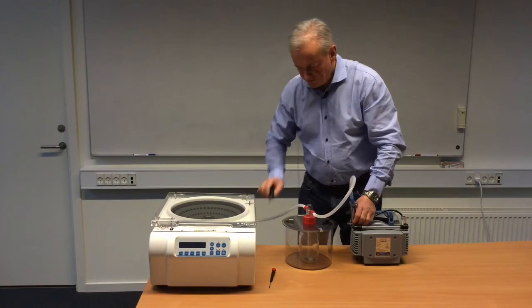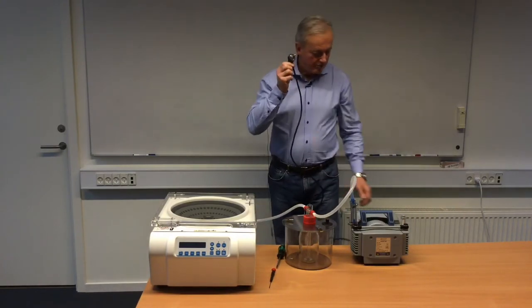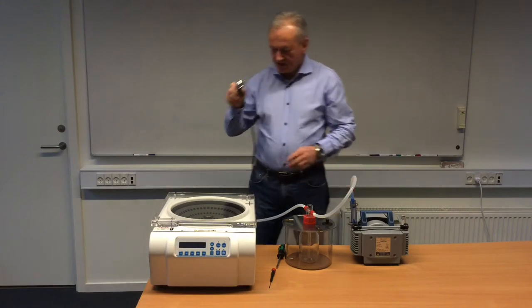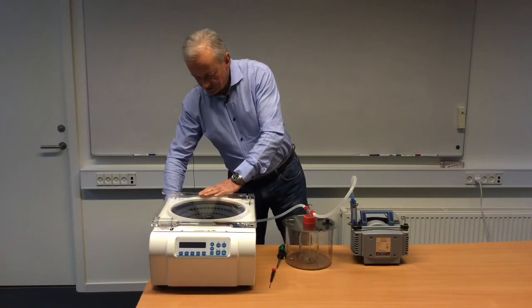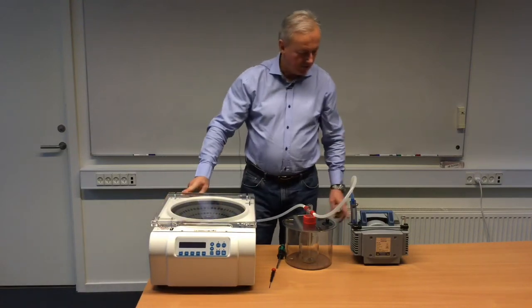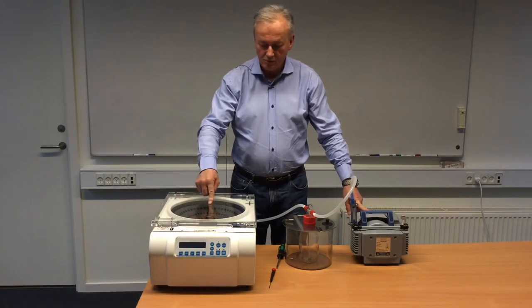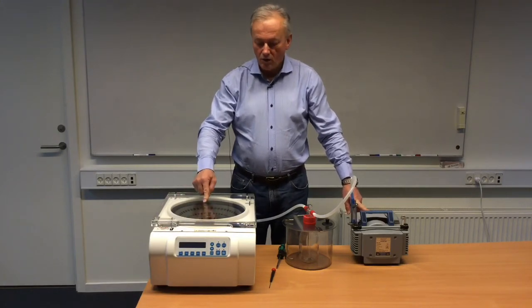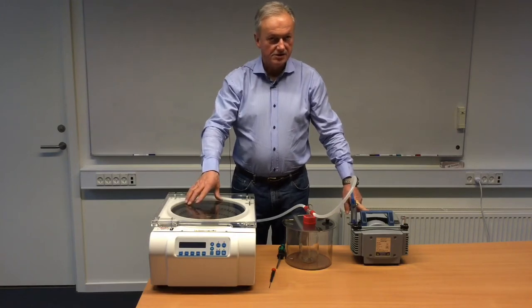So now we are ready to start the operation. The power for the membrane pump is actually attached to the back side of the centrifuge, which means it is controlled by a relay that will not allow the pump to start before the RPM is more than 1000, or if we have a set point below 1000 RPM, then when you reach the set point.